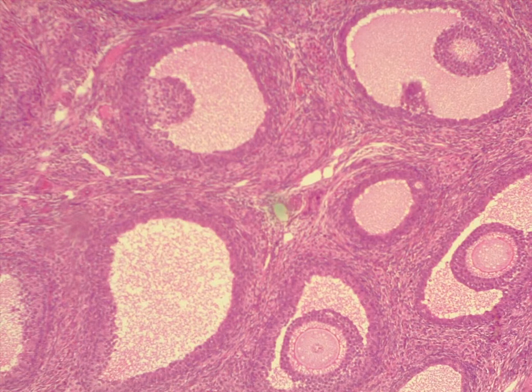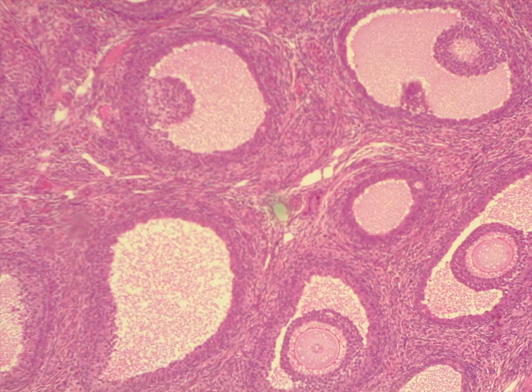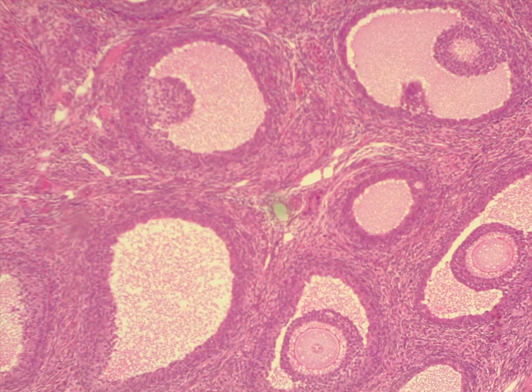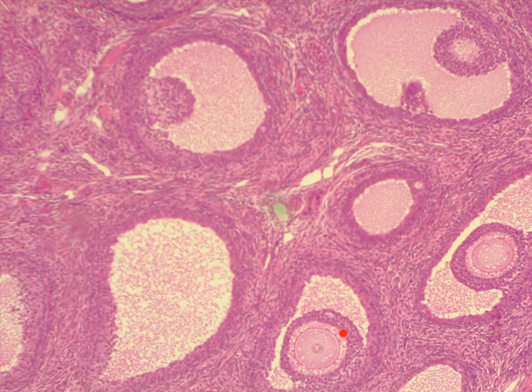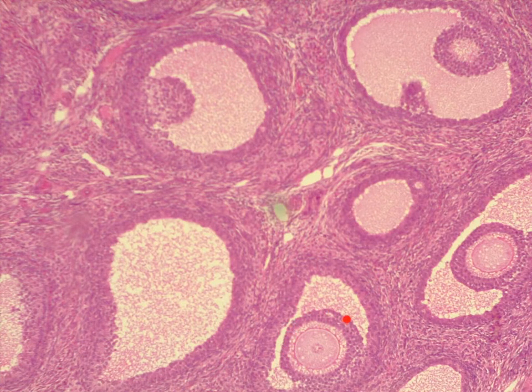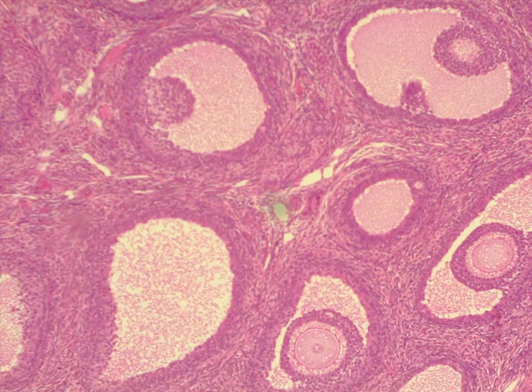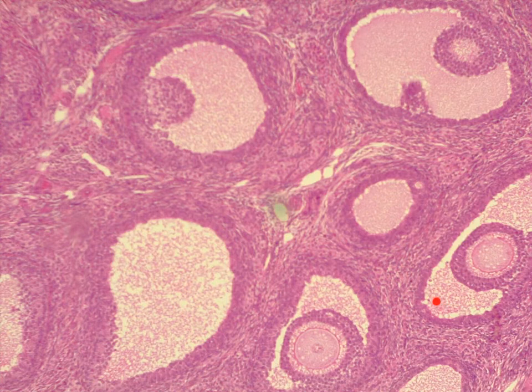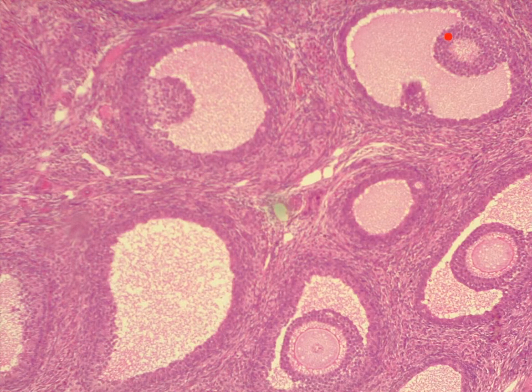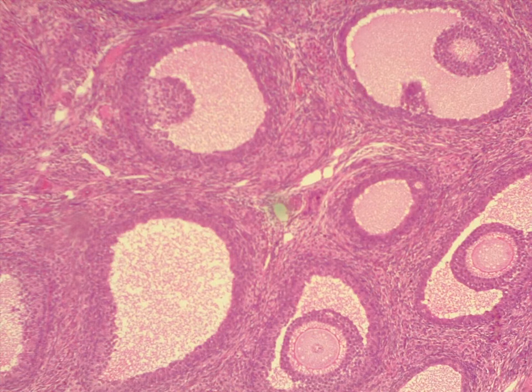This is an image of the inside of an ovary. Inside the ovary there are eggs in various stages of readiness. This here is an ovum, or egg cell, also known as an oocyte, and it is immature — you can tell because the follicular cells are all very close to it. Far over on this side one is getting more mature as the space around it grows, and up here there is a fully mature egg with a large empty follicle around it.